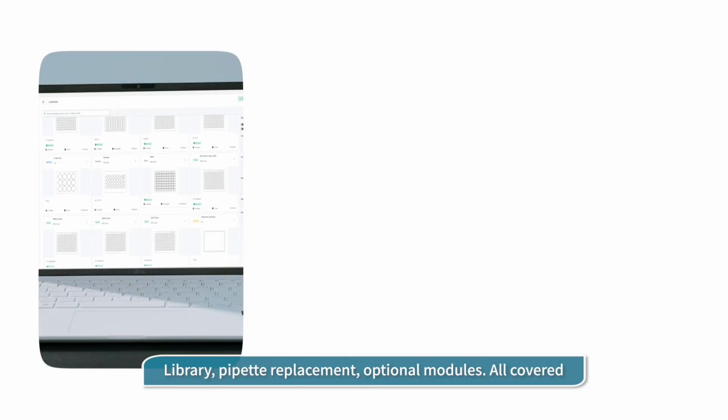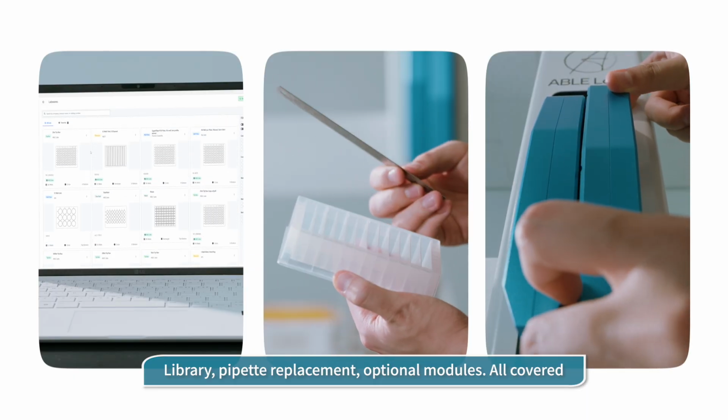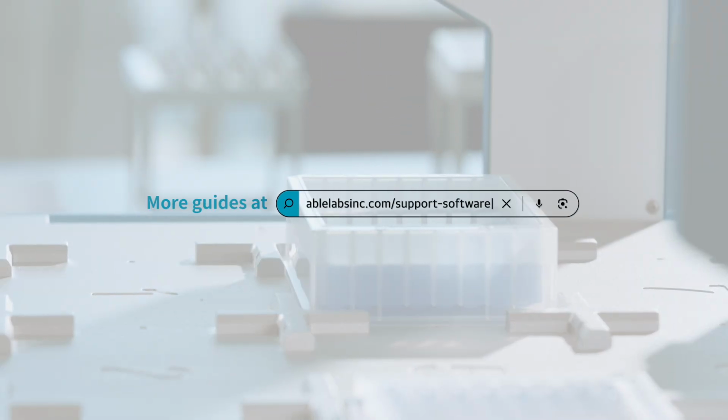We have covered the library, external Labware registration, search and filters, pipette replacement, and optional modules. For more guides, visit the Support-Software page.